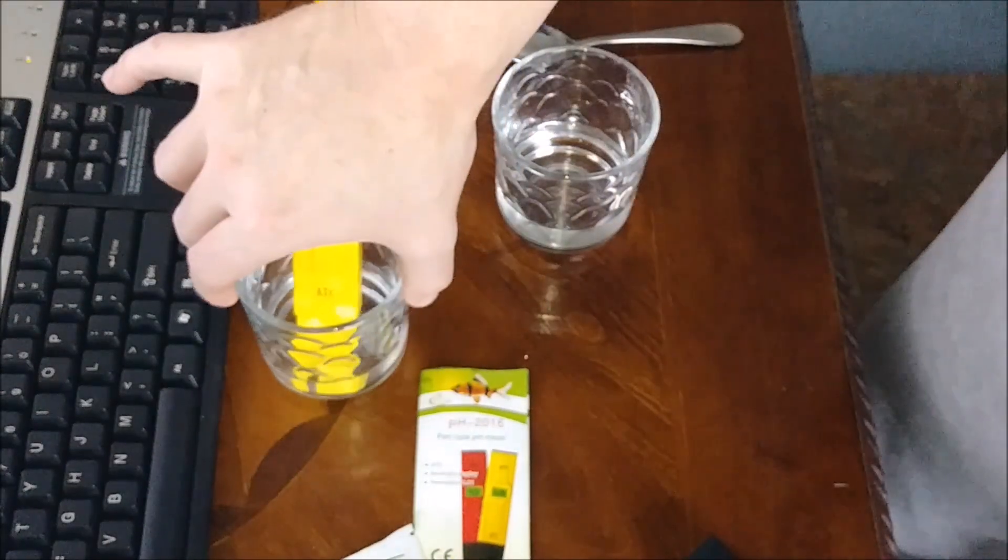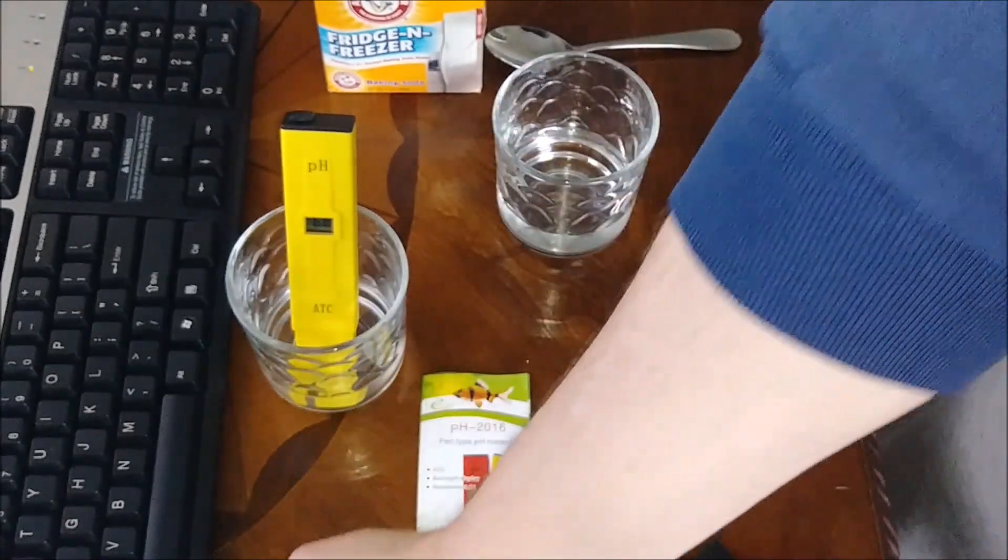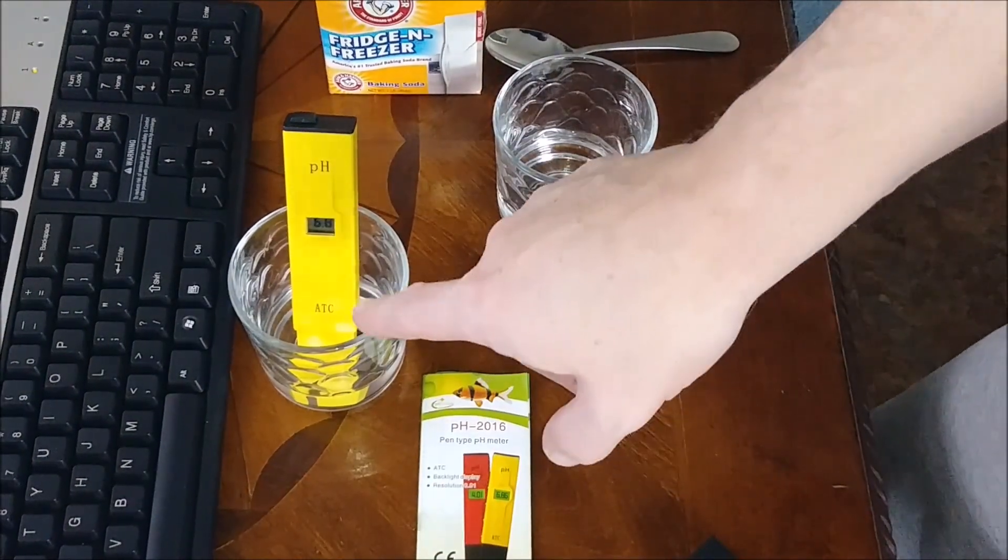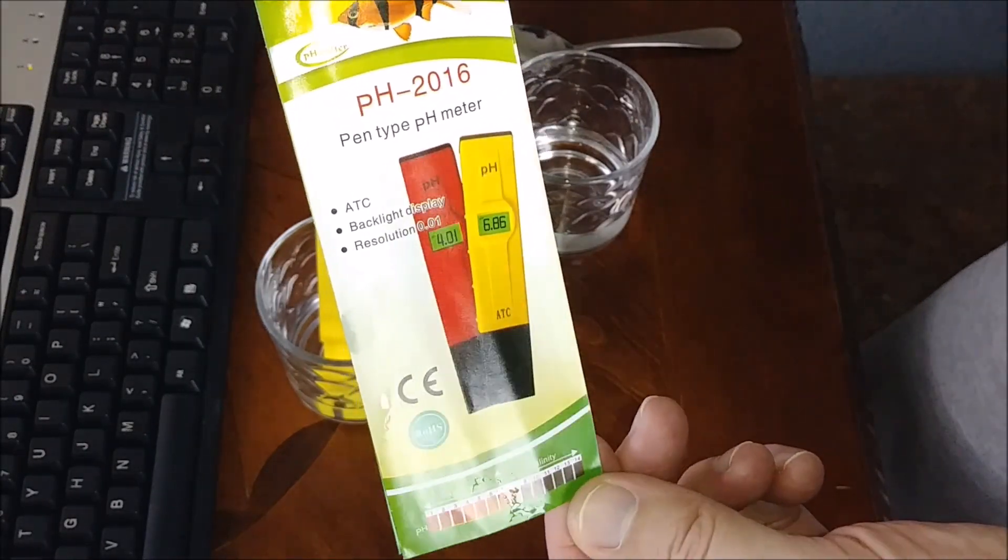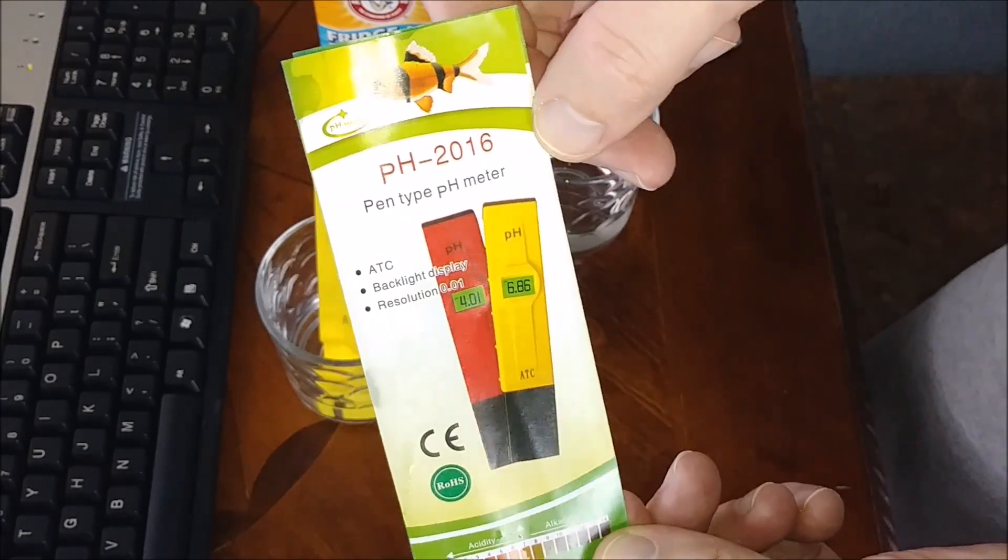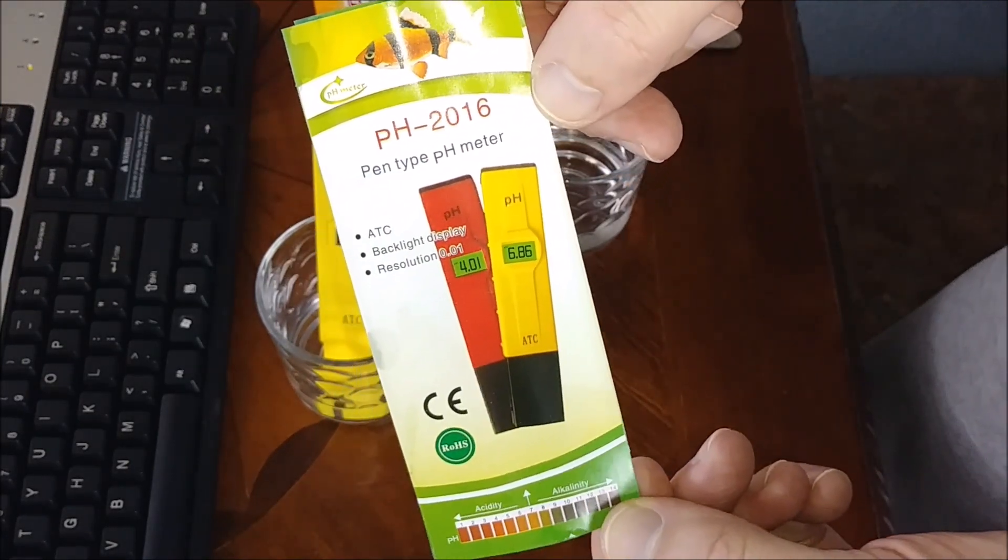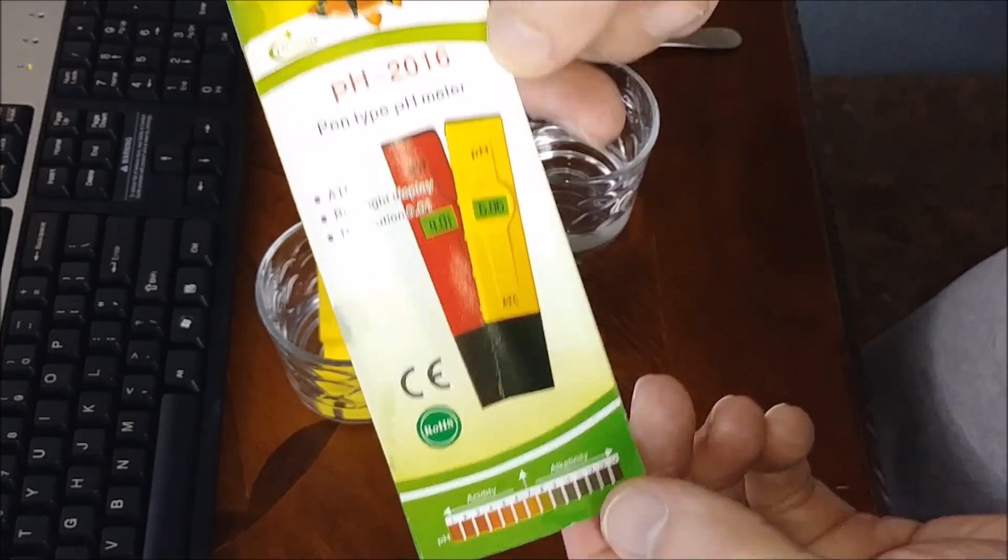Now, what if you don't have this solution that comes with the package or you ran out, but you want to check these periodically to make sure that they haven't moved on you? This is the one I have, the pH 2016. They're all the same; they're not going to change much.